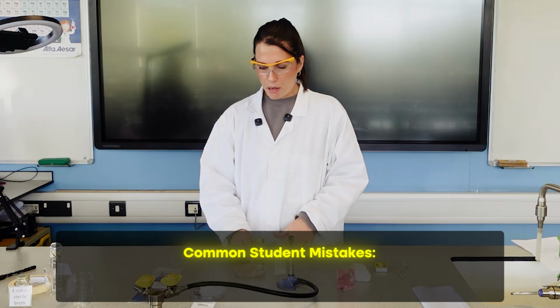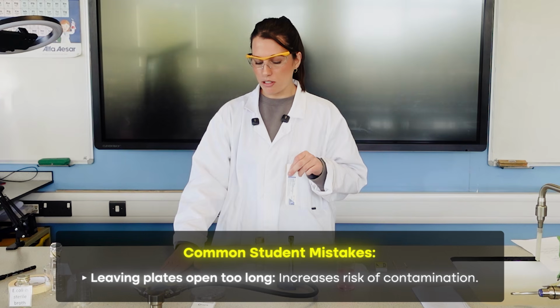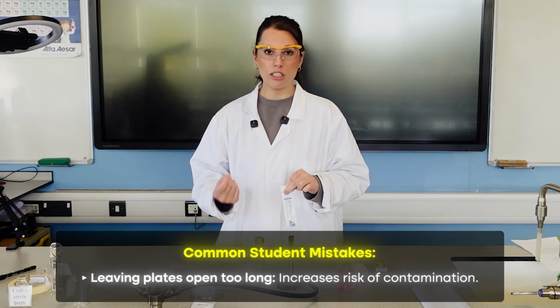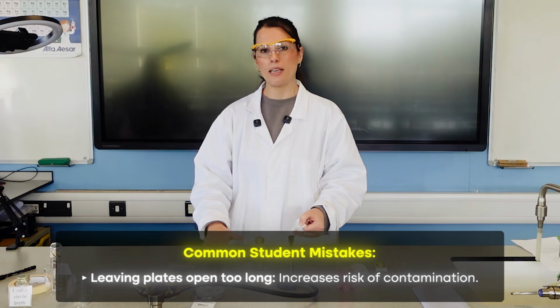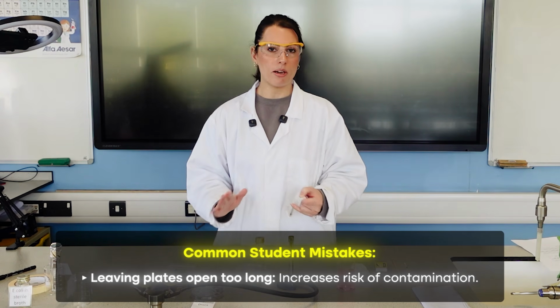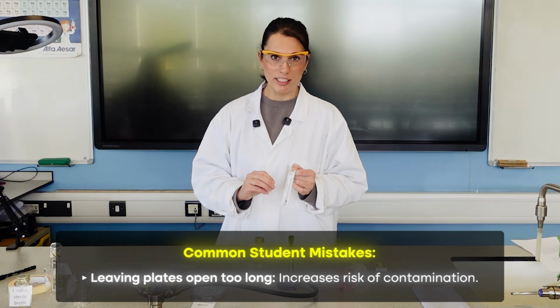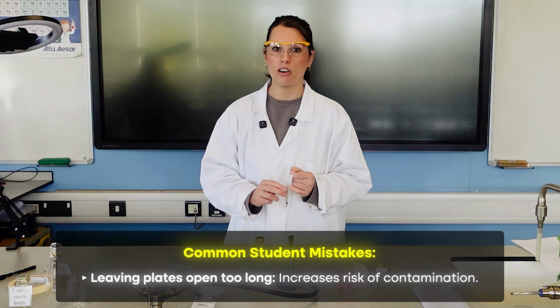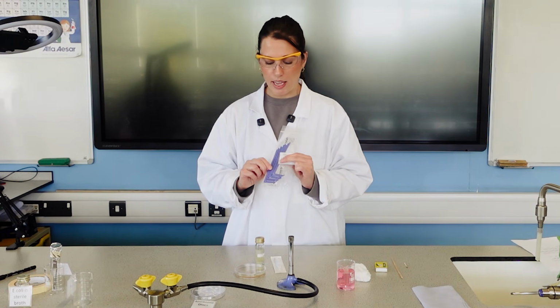So the key things to be aware of here is we've got our sterile syringe, sterile spreader. One common thing that students often do wrong at this stage is they open up all of the equipment, put it on the table, and then they leave it. That gives opportunity for microbes to land on it and it to become contaminated again. So we do not open our items until we are literally ready to use them to reduce the likelihood of contamination.